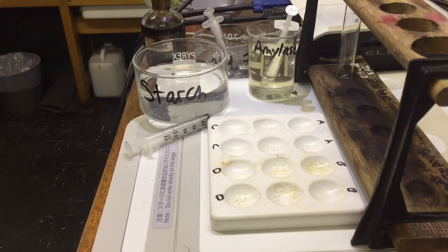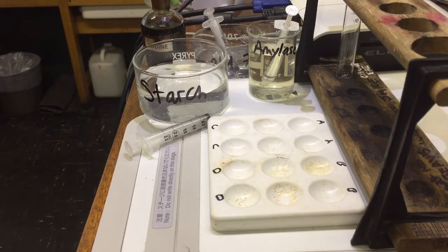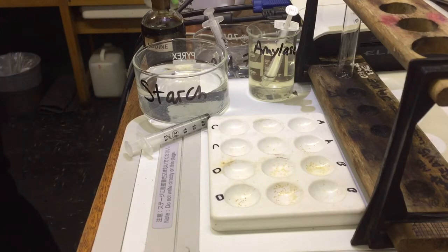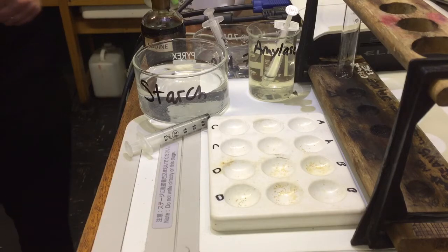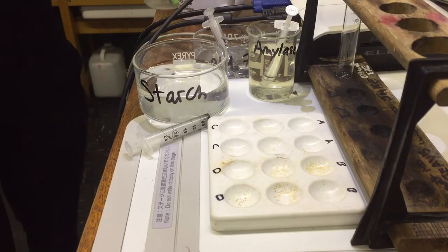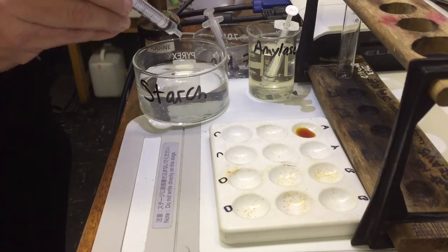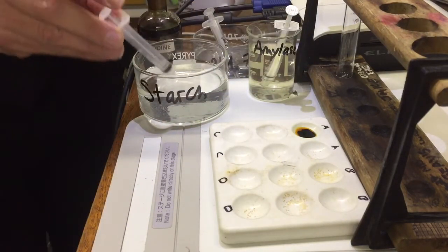Iodine will not test positive for simple sugars. So what's going to happen is if we test starch, it'll go black. But it will stay brown if there is no starch. Just to show that and test it's working, I'm going to take a little bit of iodine, put iodine in here, and add one drop of starch — just to prove it works. There we go. That's what we're looking at as a positive reaction.